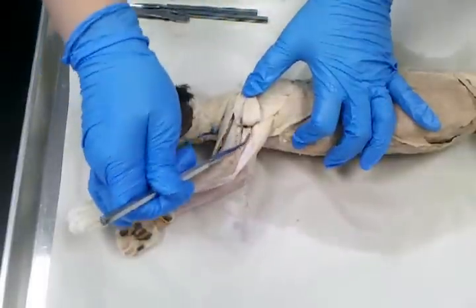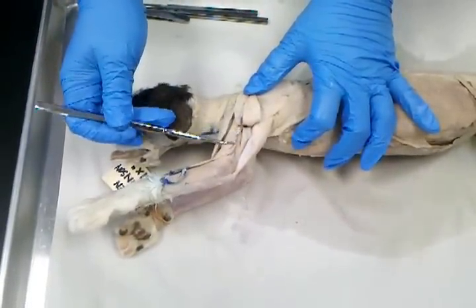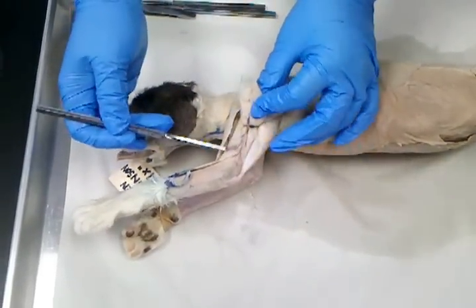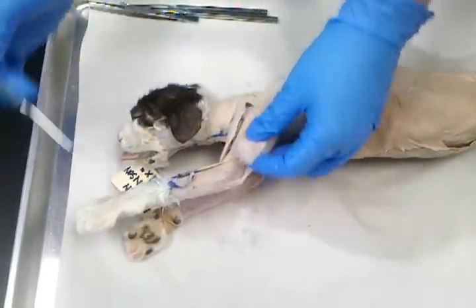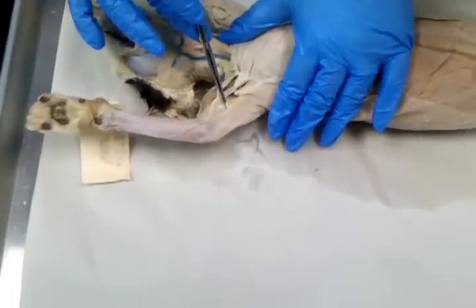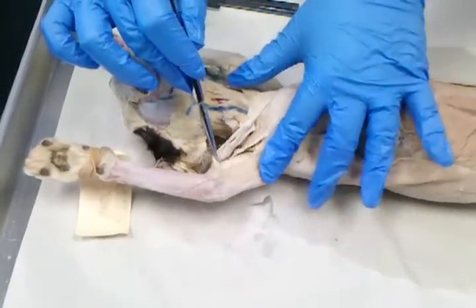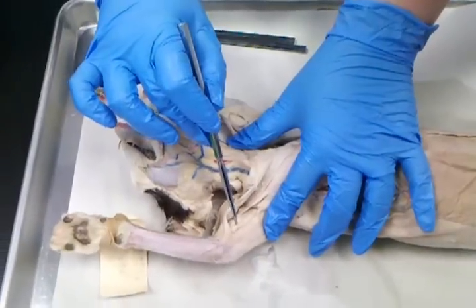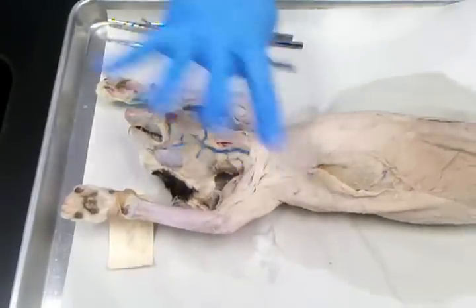Okay? Now, also deep on the outside of the arm is the brachialis muscle. Okay? And you can see part of it when the lateral head is in place, but you cannot see all of it unless it's flipped back. Okay? So that's the top muscle on the outside of the arm. On the inside of the arm, you've got the epitrochlearis, which is this skinny muscle right here. Okay? And then deep on the top part of the arm, you've got the biceps brachii. Okay? All right. So that, oh, there's one more.